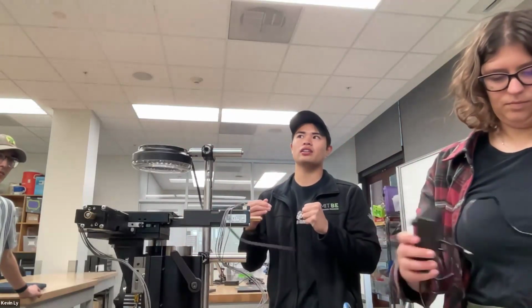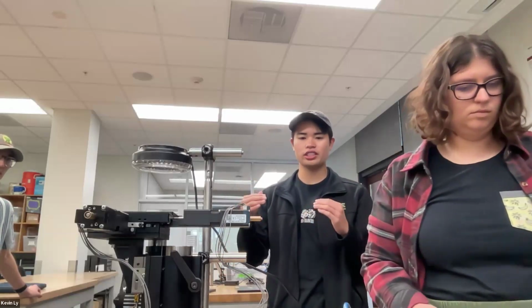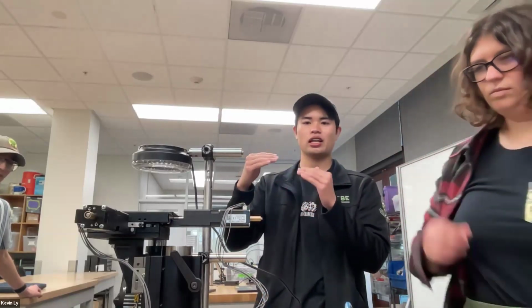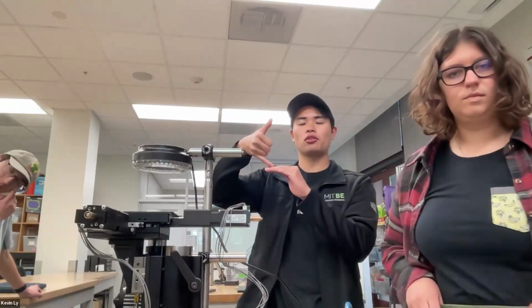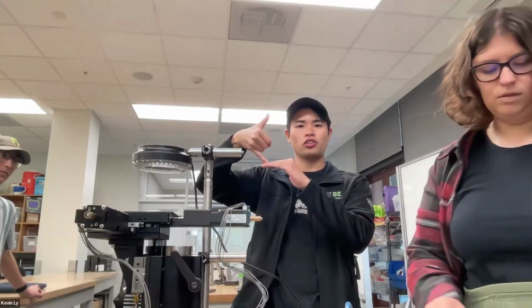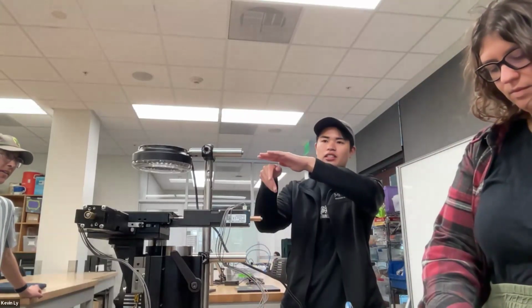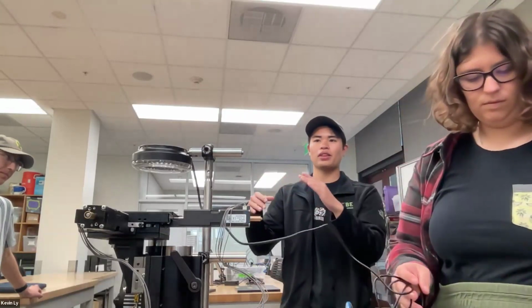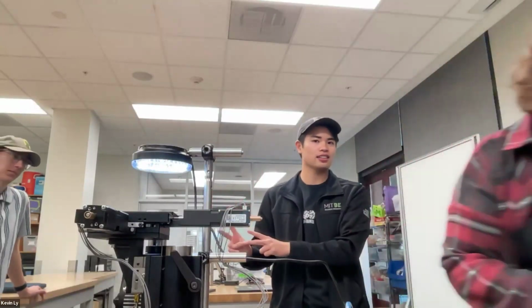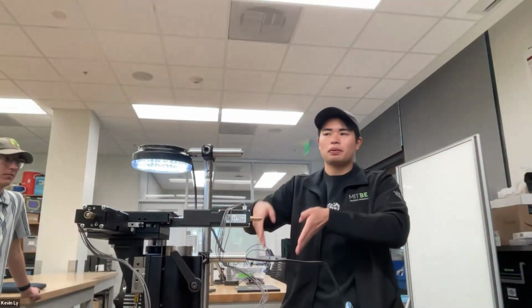If you look up any optics diagram for a microscope, you'll see there are two major lenses. There's the objective lens, which is the closest to the object, and it's usually positioned one focal length away from the object. So now you have parallel light, or what people call collimated light. That parallel light will feed into the second lens, which is called the tube lens. The tube lens only sees parallel light.